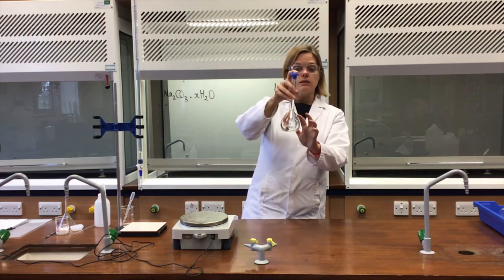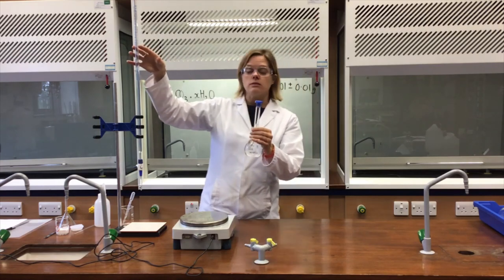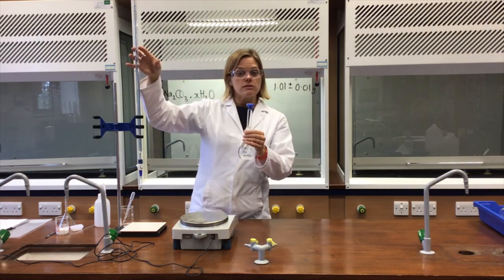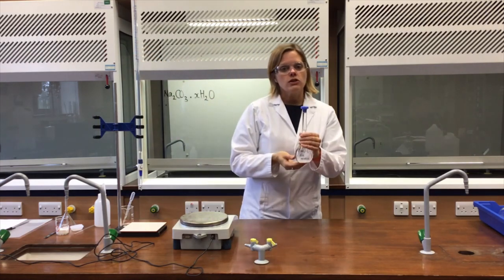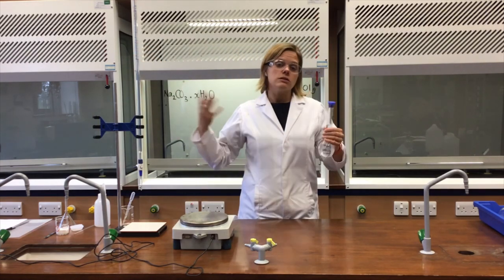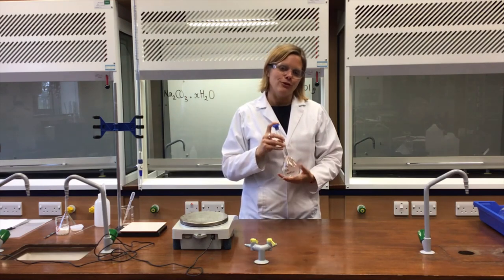That's part one of the practical. Part two involves titrating this solution with hydrochloric acid in the burette to work out the concentration, using the same titration techniques as we've met before.